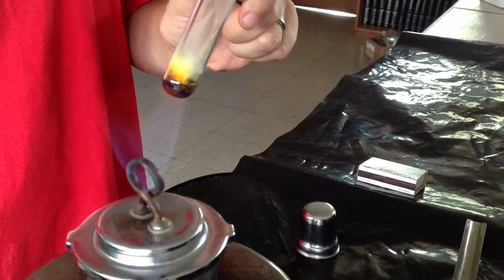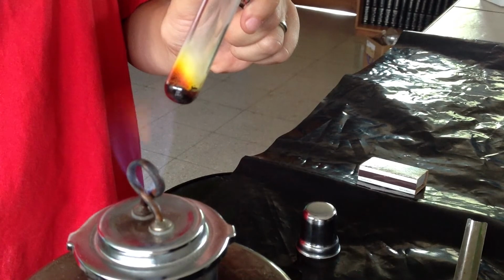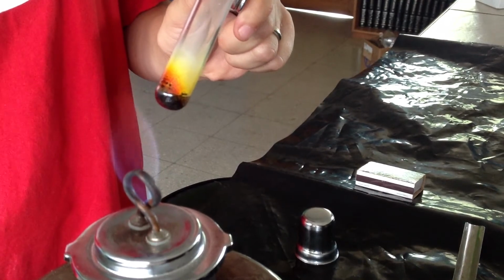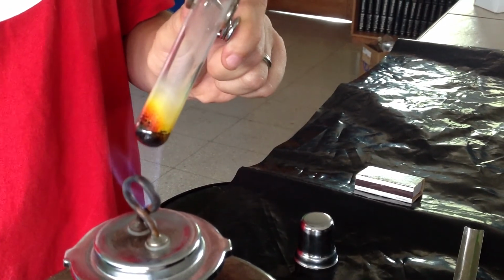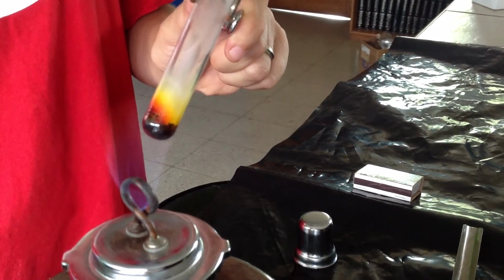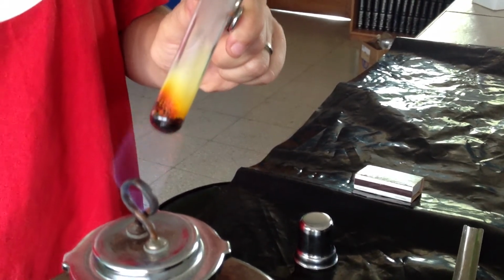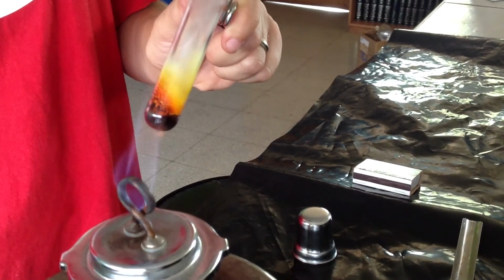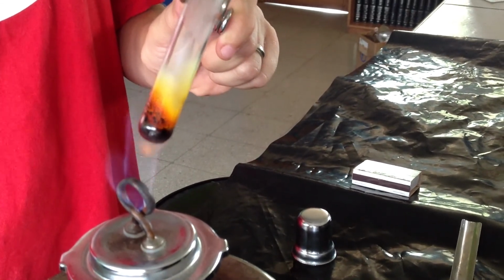Evidence right there. There's some good evidence right there. A few good evidences going on right there. Oop, get back in my flame. So again, you'll have to tell me what kind of a reaction this is, what kind of evidence there is that a reaction is taking place.